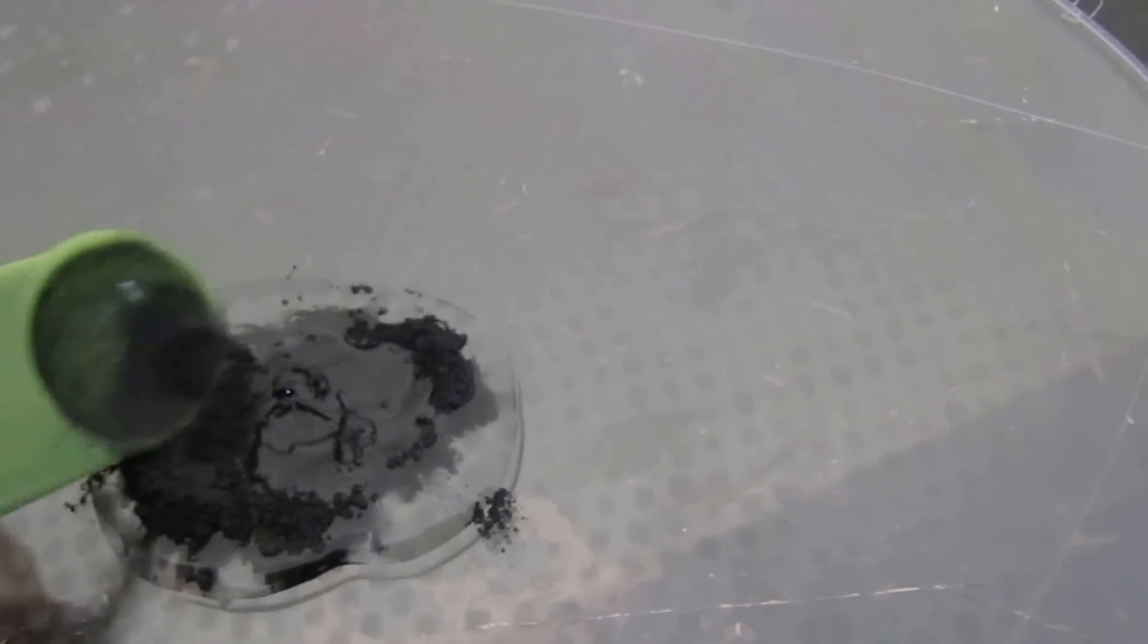Now I've got about a quarter of a teaspoon of the ferrous material, and we're going to mix it all together to make a sort of a paste. I'm doing that right now. I'm kind of even grinding it a little bit to sort of break out any clumps. But the purpose of the oleic acid should basically be to do the same thing.